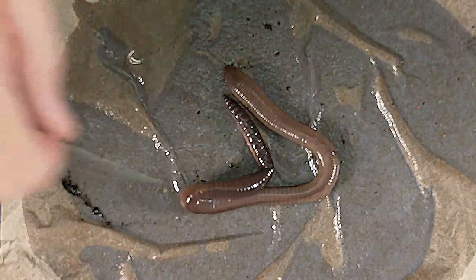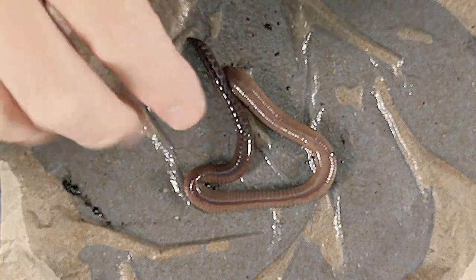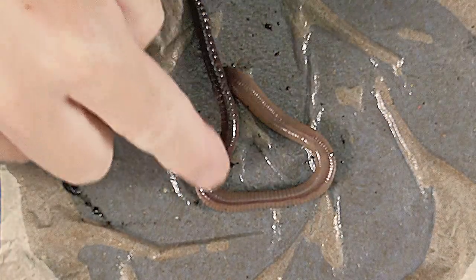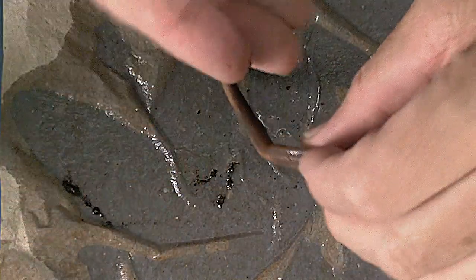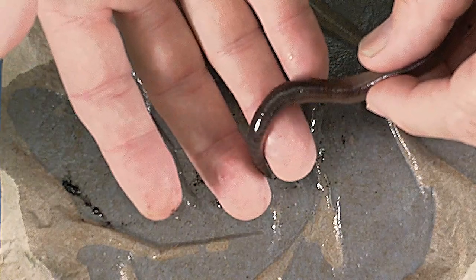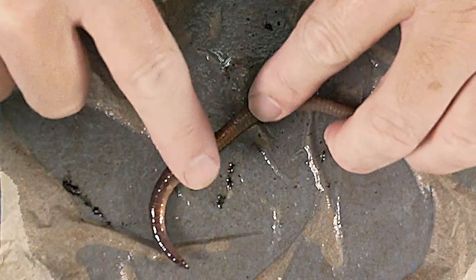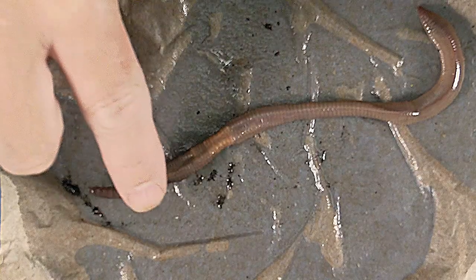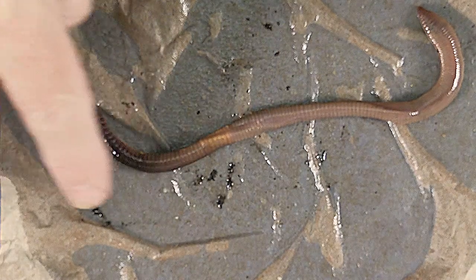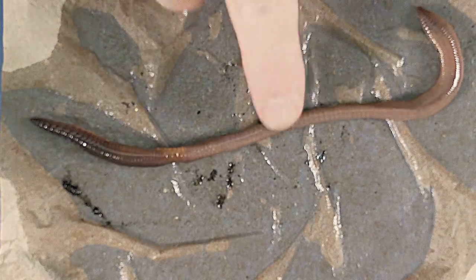Some external characteristics of the animal: first, get oriented to its dorsal versus ventral surface. It likes to be ventral surface down and dorsal surface up. The dorsal surface is a lot darker than the ventral surface. I'll flip it over — there's the lighter ventral surface and the darker dorsal surface. The animal always rights itself, going ventral surface down. I can't refer to it as he or she because earthworms are hermaphrodites.